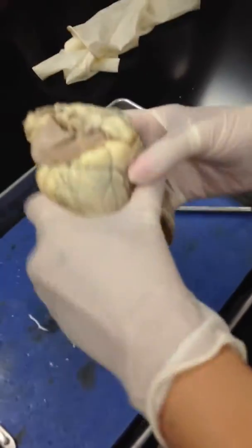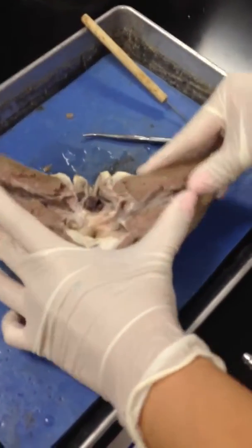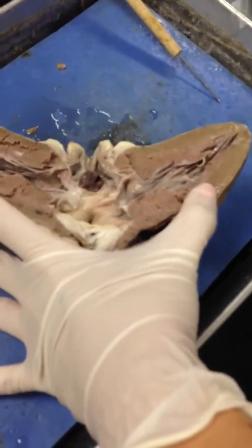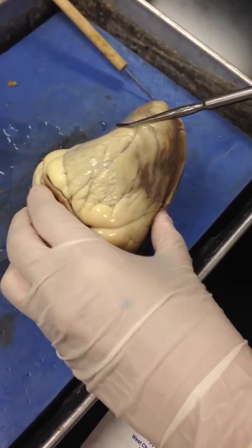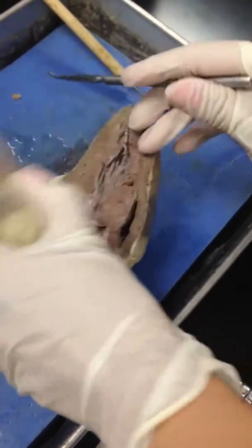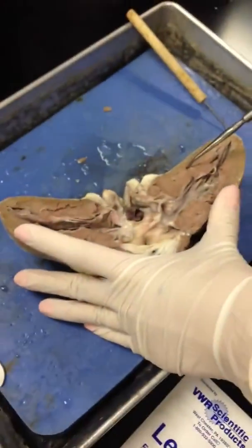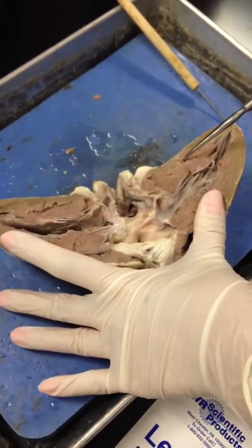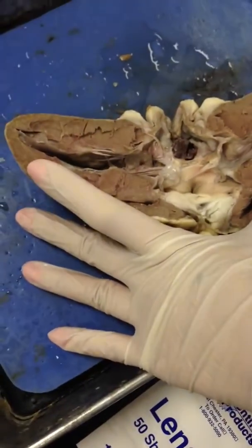So let's identify a few other structures inside. We have different layers of the heart. What layer is this? Epicardium. Epicardium, also known as the visceral pericardium — so you can use either or. Then this pinkish part right here is what? Myocardium. Myocardium. Good. And then the innermost layer? Endocardium. Good.